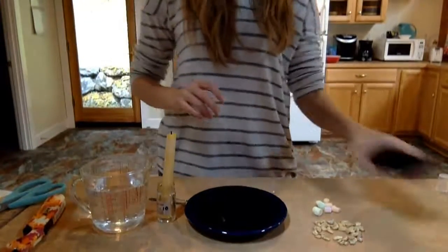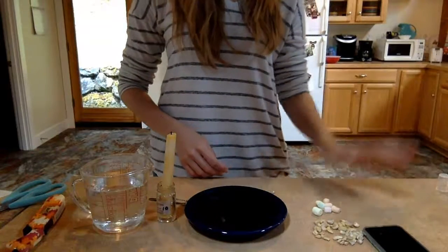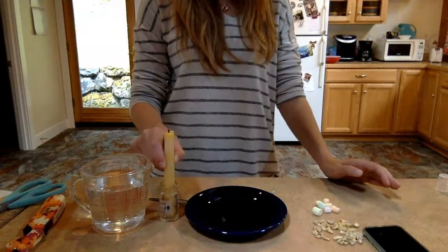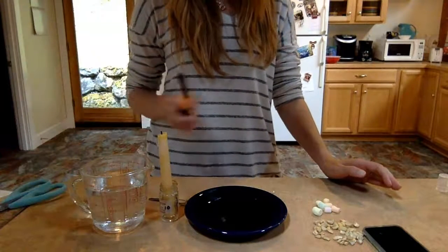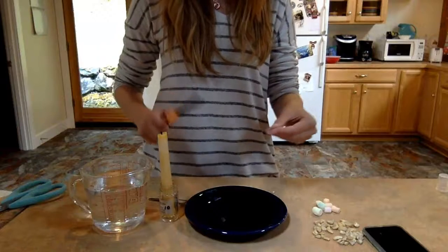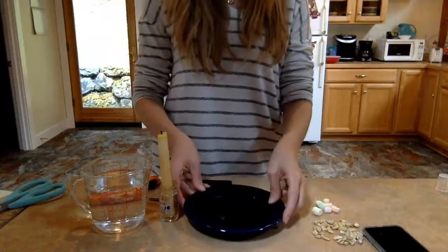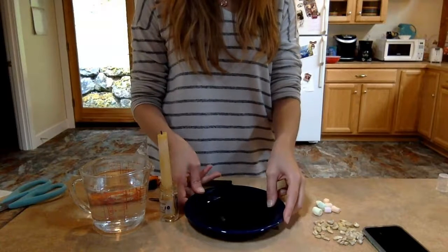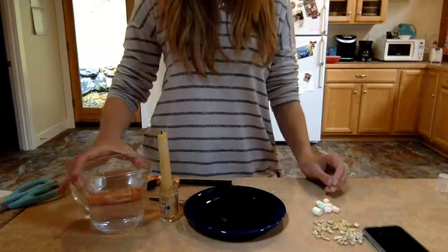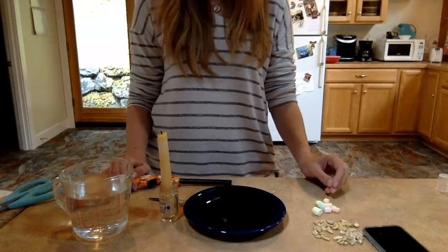So, I've got a stopwatch on my phone, or you could use one on your watch. I have a candle for lighting things on fire. You could also just use a lighter and maybe have a sibling help or a parent help because fire can be scary sometimes. I have a plate that isn't paper to catch the things I set on fire, just in case. Anytime we're dealing with fire, I'm going to have water nearby to help put out any potential fire.